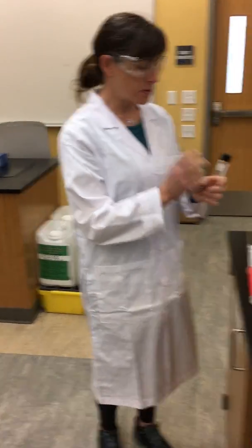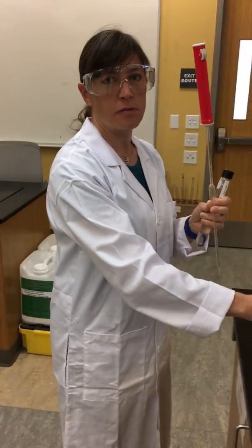So the first thing we're going to do is pipette using our volumetric pipettes 10 milliliters of the hydrochloric acid solution into our Erlenmeyer flask.